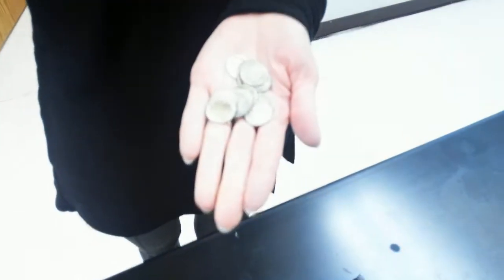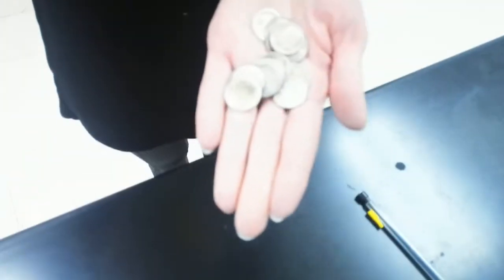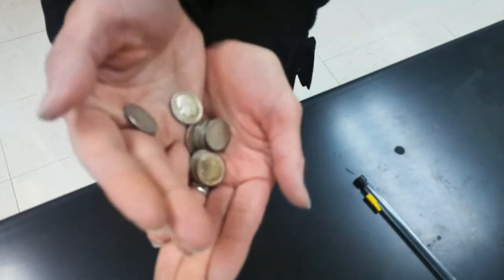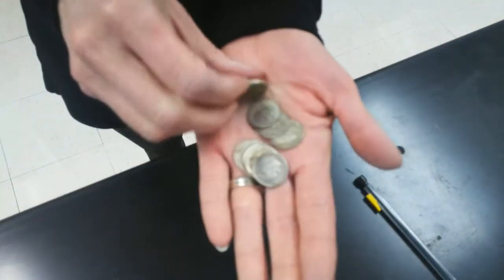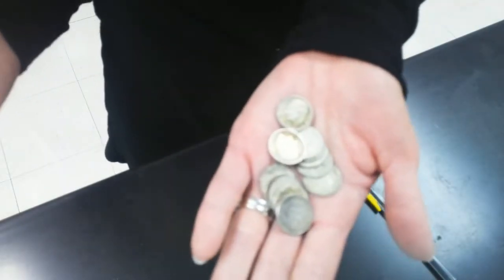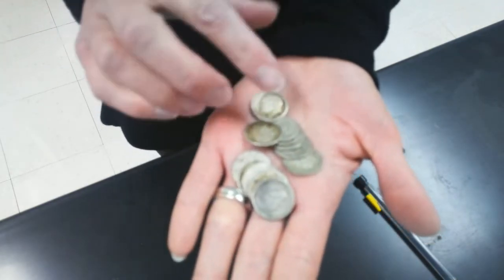So I have in my hand some special dimes. These are not just any dime, they're silver dimes. They're an alloy of copper and silver, so obviously you can't see that there's copper in there, but there is. So these aren't just your normal dimes. These cost a little over a dollar. I usually have to go to like a rare coin, like a sketchy place to get them that's got bars on the outside windows, but I do it for you.